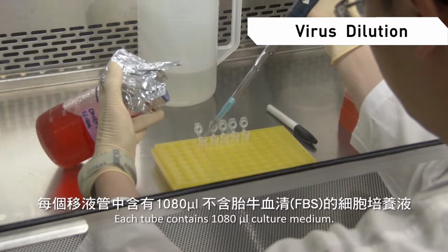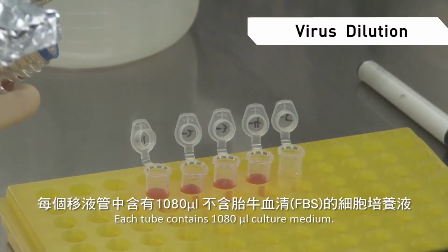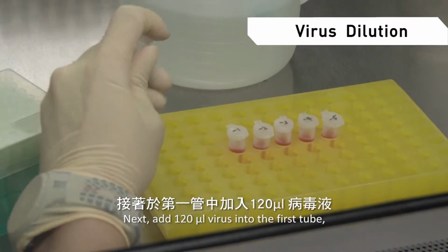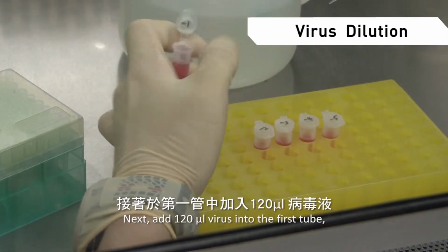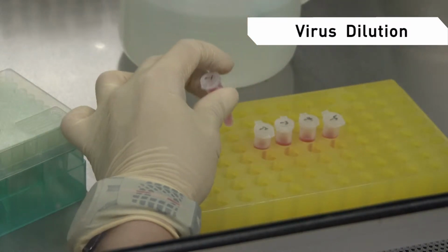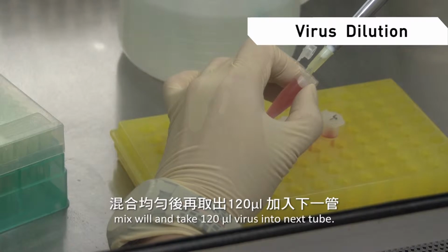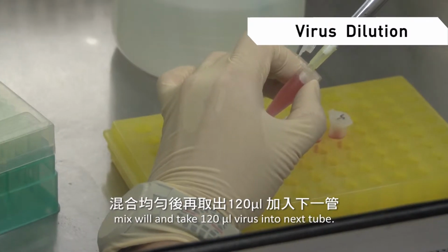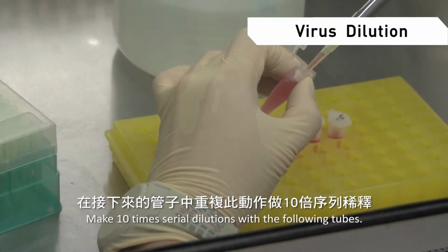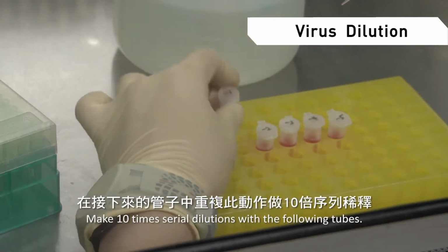Each tube contains 1080 microliter culture medium without FBS. Next, add 120 microliter of virus into the first tube. Mix well and transfer 120 microliter into the next tube. Make 10 times serial dilutions with the following tubes.